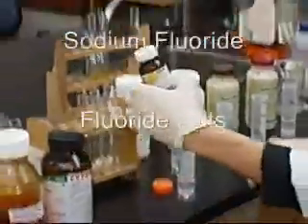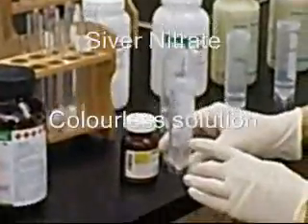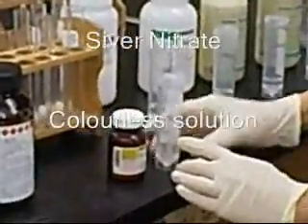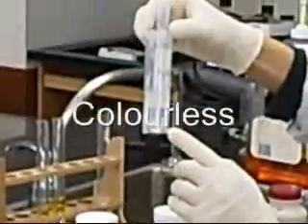Next, silver nitrate crystals are dissolved in water to get silver nitrate solution. This solution is colorless.